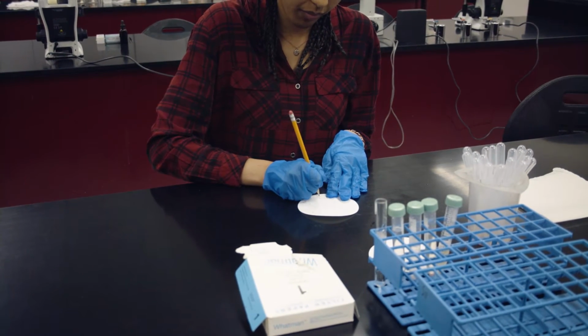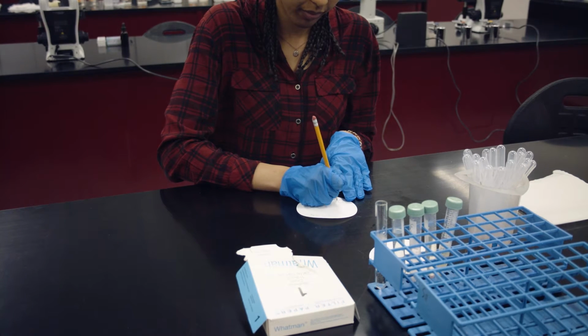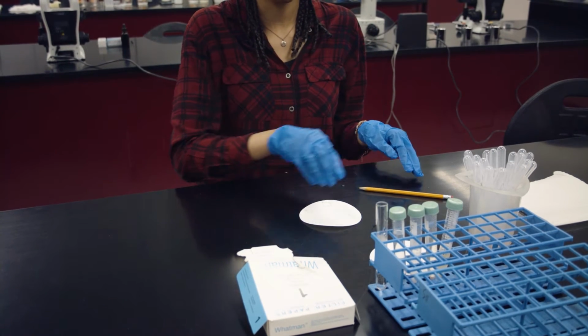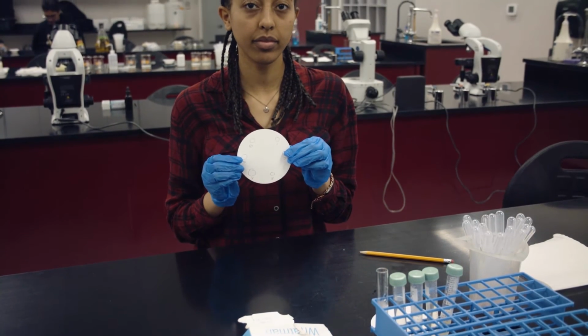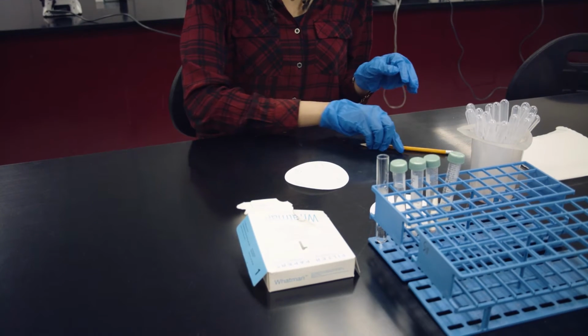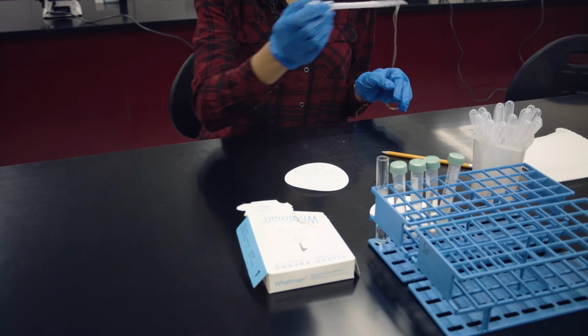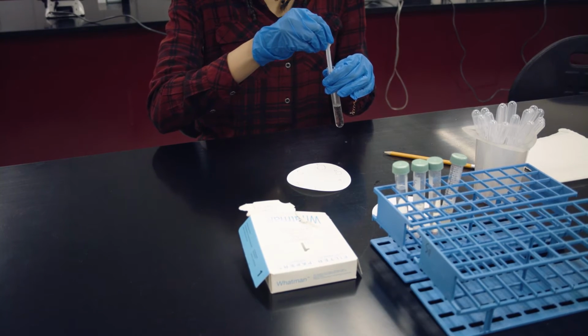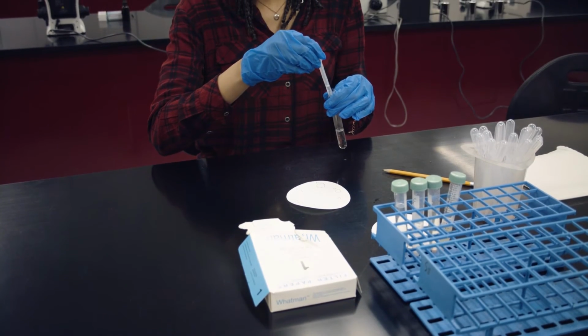The 6 circles should be spaced equally apart from one another, and starting in a clockwise direction, be sure to label the circles from 1 to 6. Each circle will then represent a unique sample. Be sure to put your initials somewhere on the edge of your filter paper so that you can properly identify your sample later.